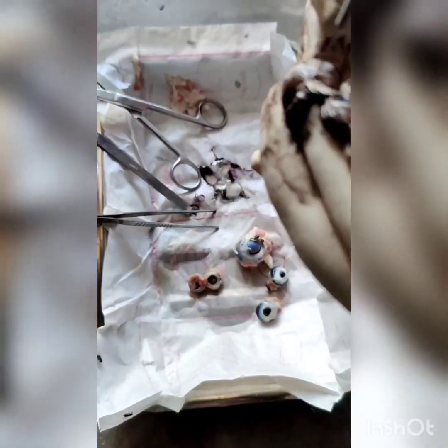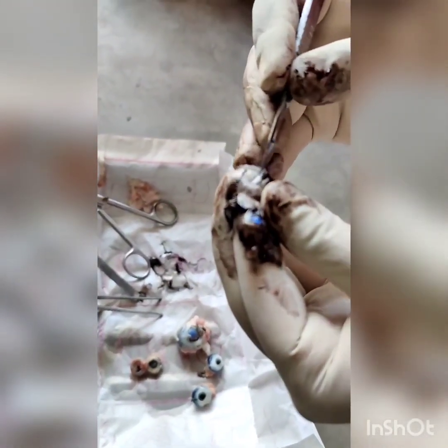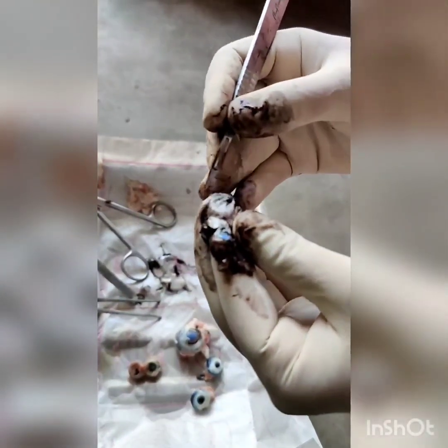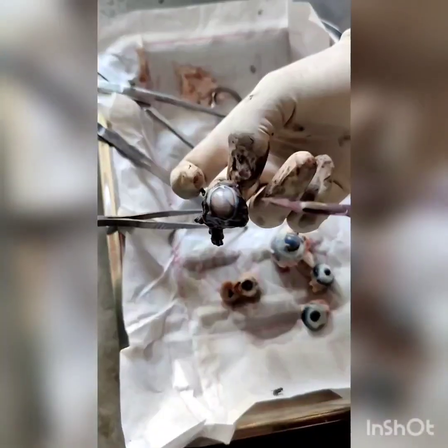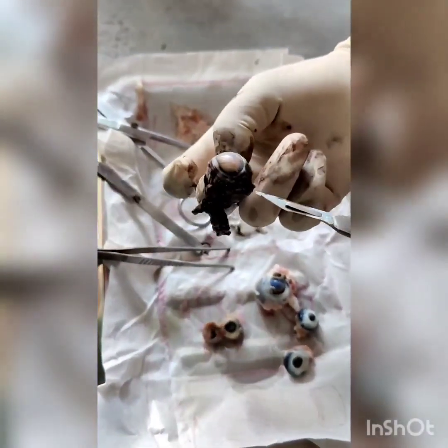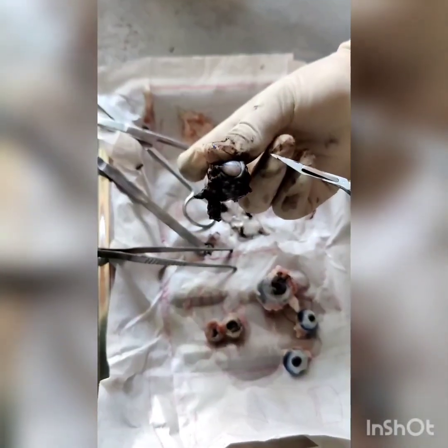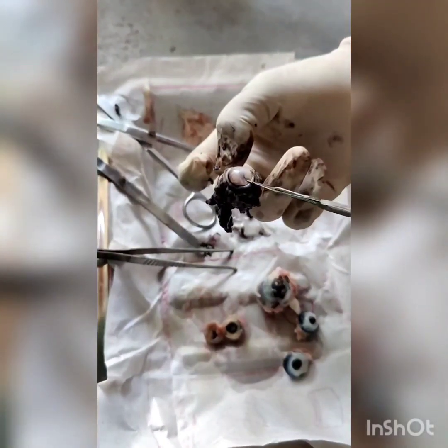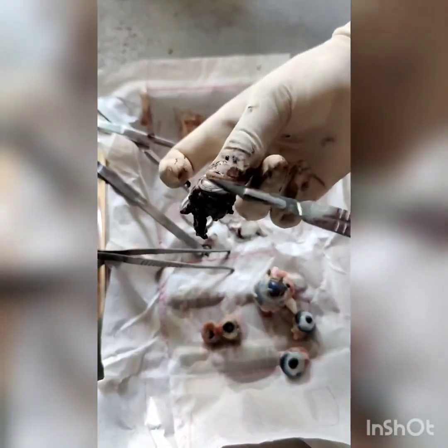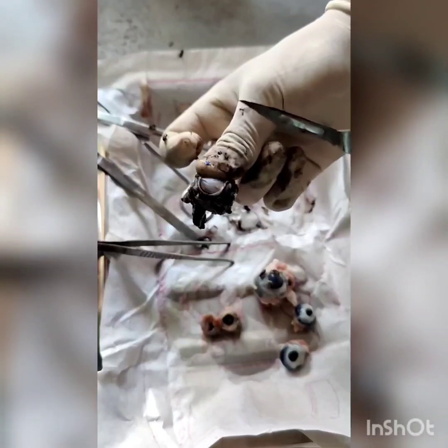I am trying to cut the retina. Near the lens you can see the suspensory ligaments — the suspensory ligaments extend the lens capsule and maintain the position of the lens in the center. Involuntary ciliary muscles lie in the depth of the ciliary body. Behind the cornea we have the iris, and then the pupil.